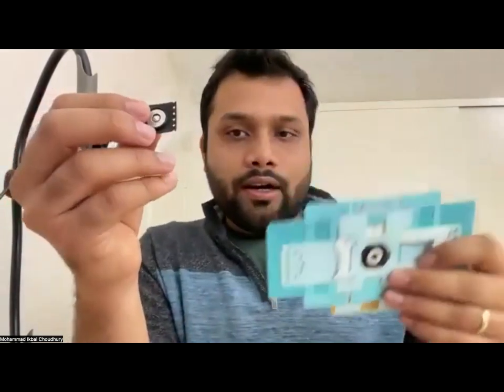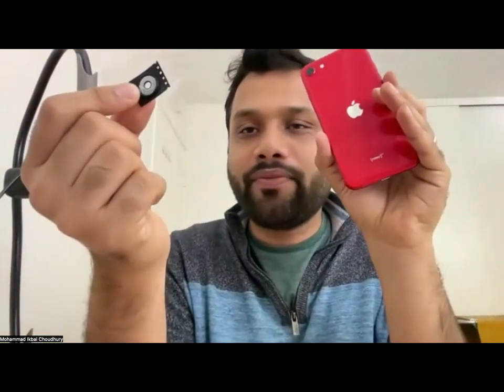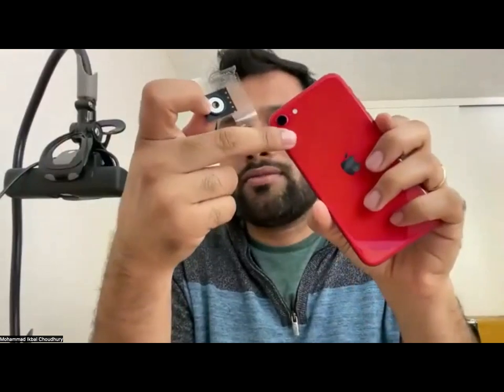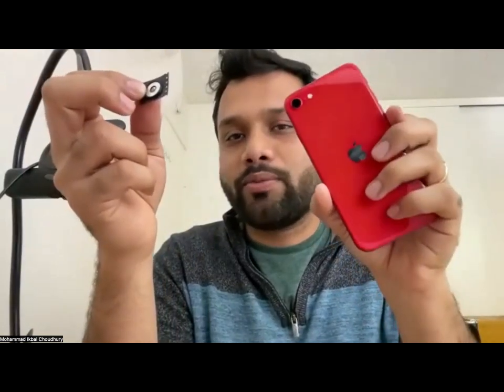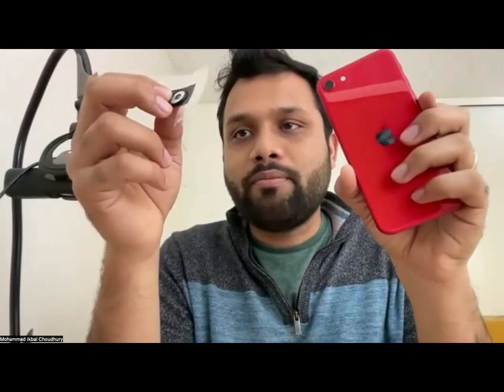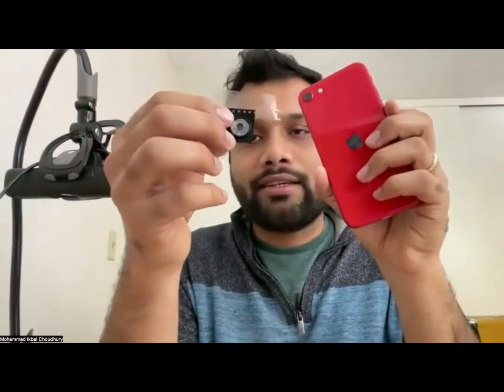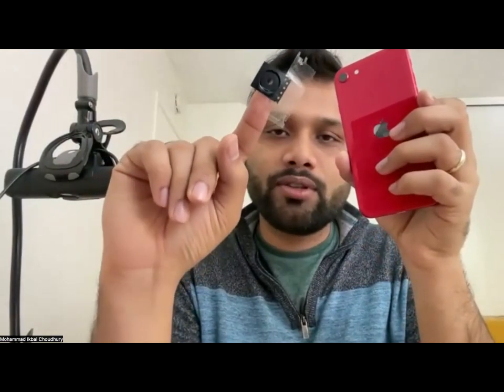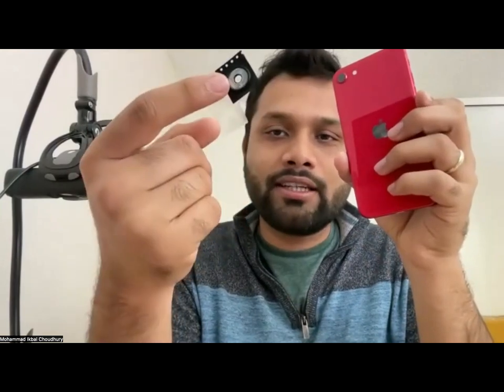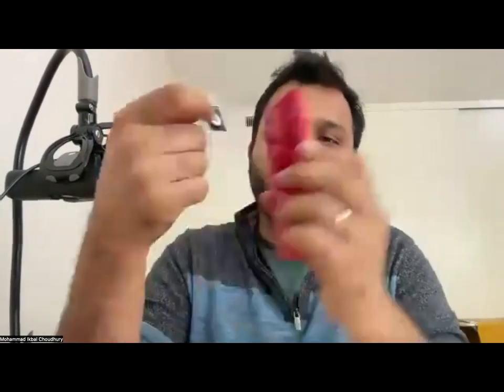Now, the task at hand right now is to connect the magnetic strip to the cell phone so that we can connect our cell phone to the microscope easily. And that's where we have to make sure that the alignment is perfectly done. So now I know that this side of the magnetic strip will fit into the microscope, right? And the other side has to go towards the cell phone camera. So it has to be like that.